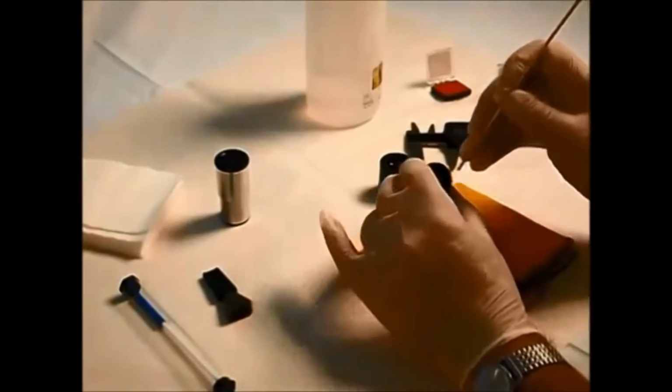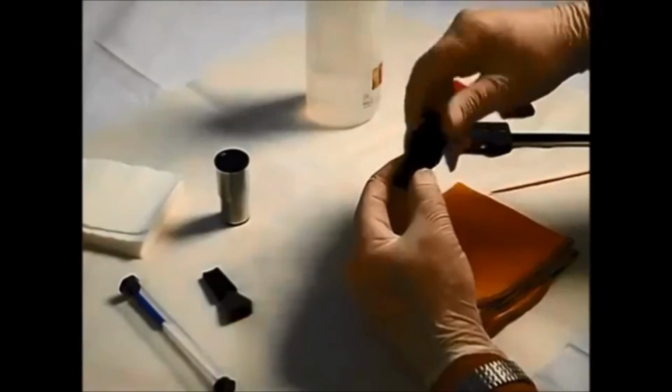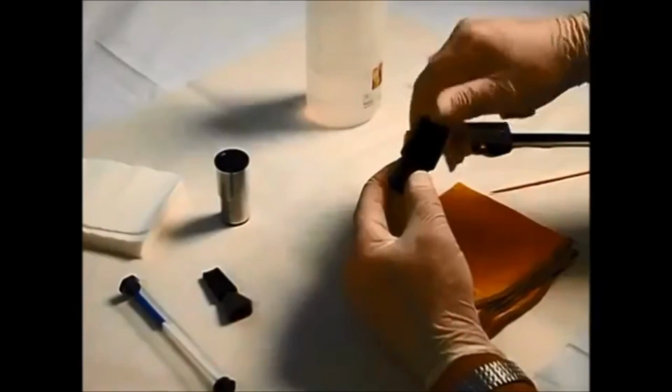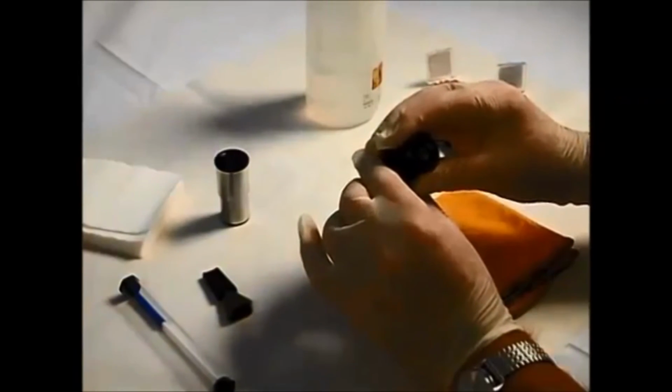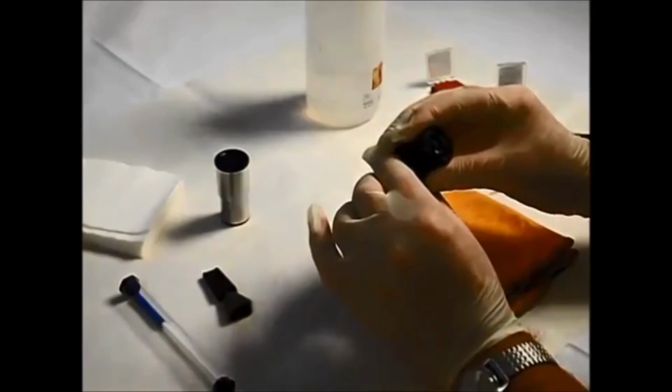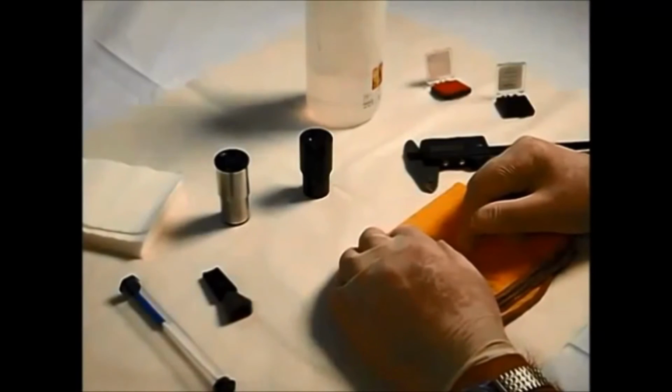It's the downside, of course, of using gloves. It can be a bit awkward. It's far harder with marigolds. Now then, reassemble. And there we are. That's a nice working reticle, nice and clean. Numbers around the right way. So we've actually fitted those together correctly. They're ready now to go back into the eyepieces of your microscope.